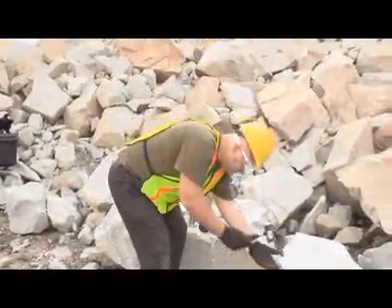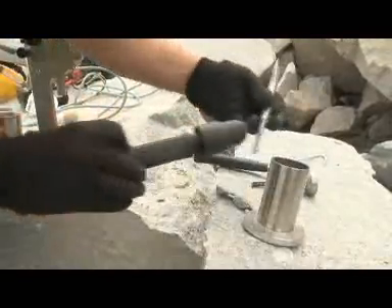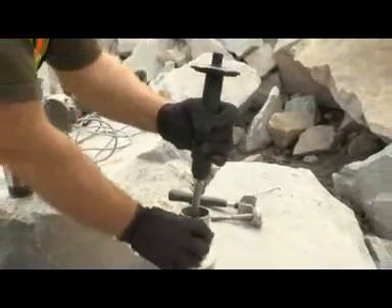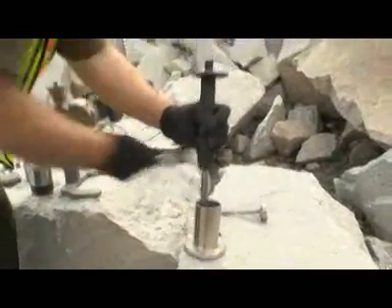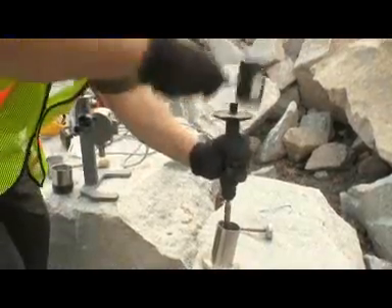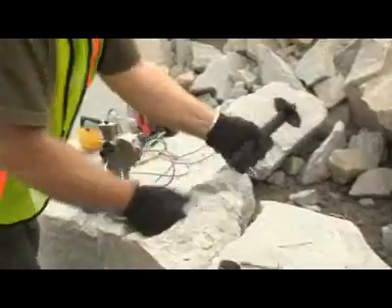Preparation for using the mill begins with chipping pieces from the rock sample. Once you have some rock samples, place them inside the crusher base. With the chisel attachment placed into the holder, break the larger pieces into smaller chips. Continue to place enough pieces into the base until you feel there is enough material which represents your sample.